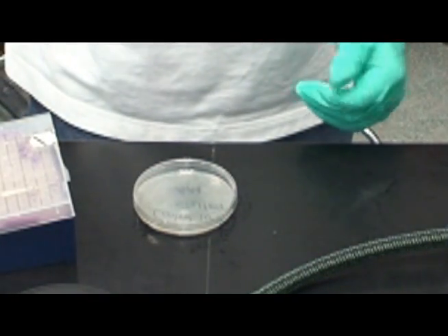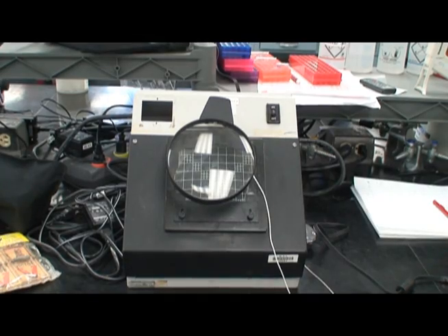This process is repeated for the other plates, at which time all the plates are incubated at 37 degrees C.